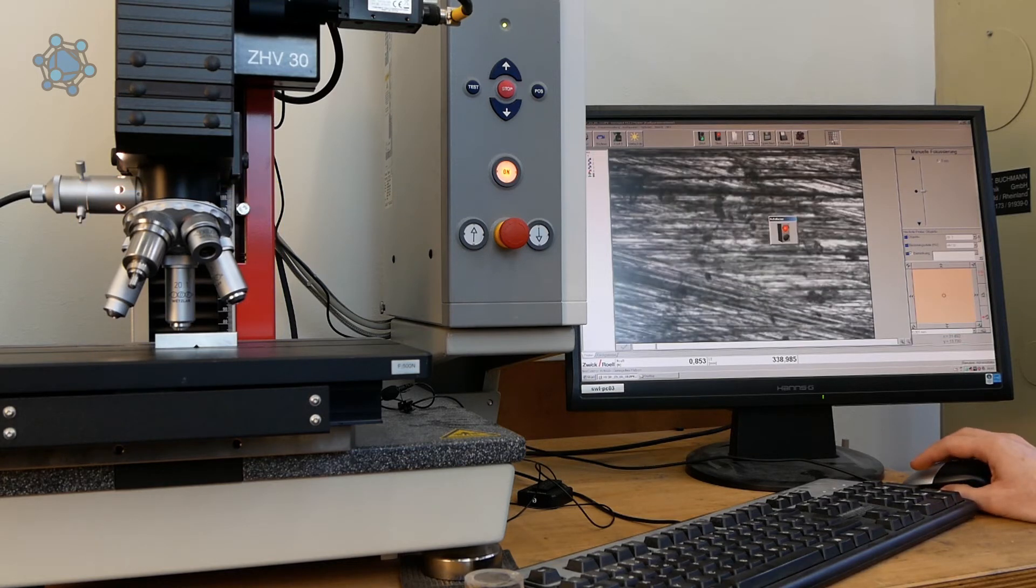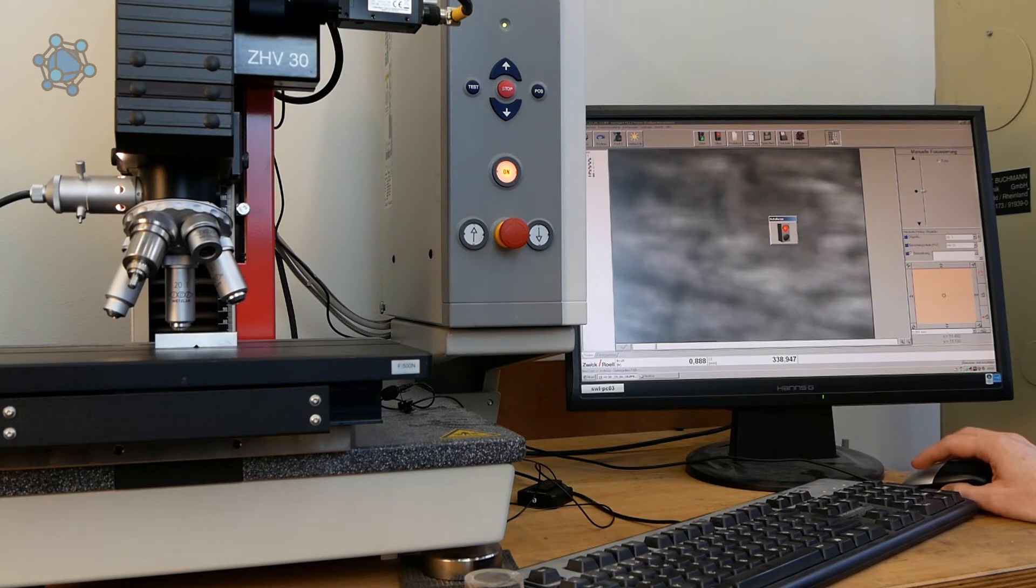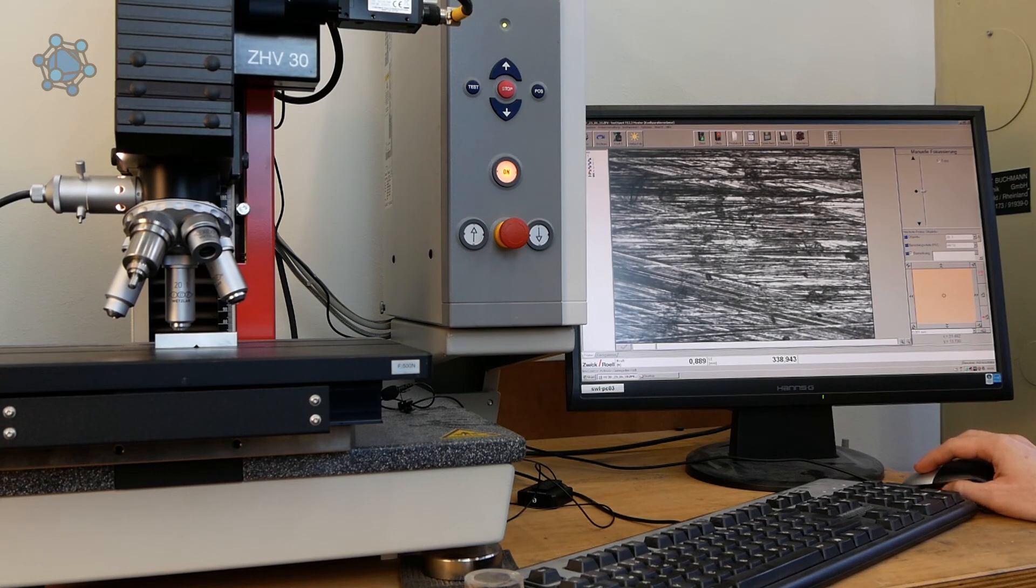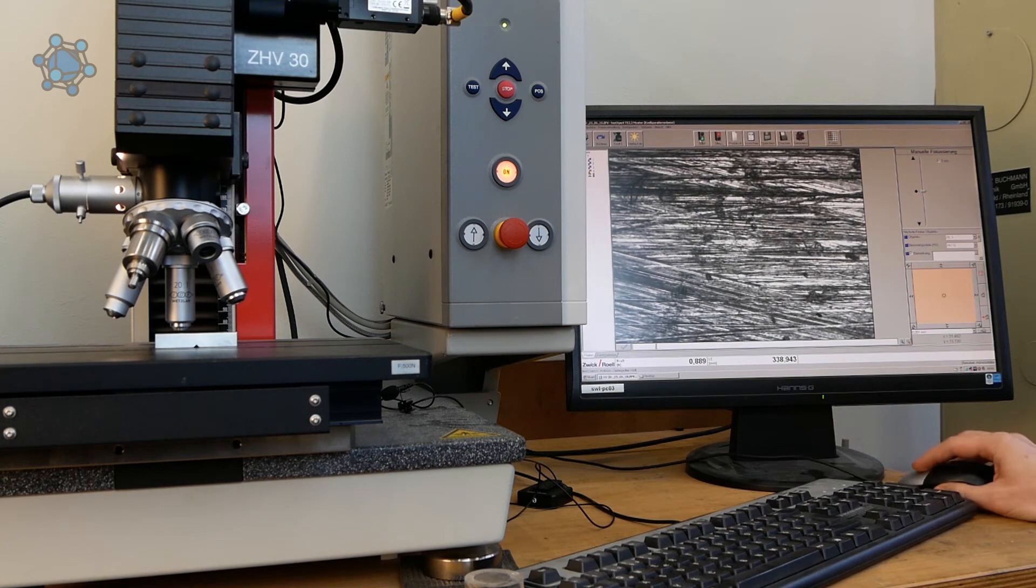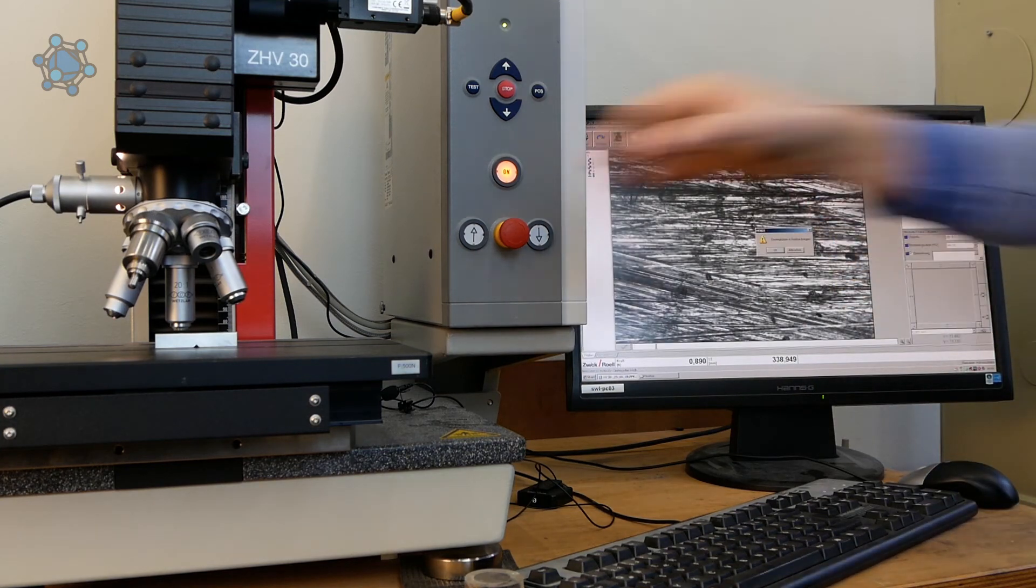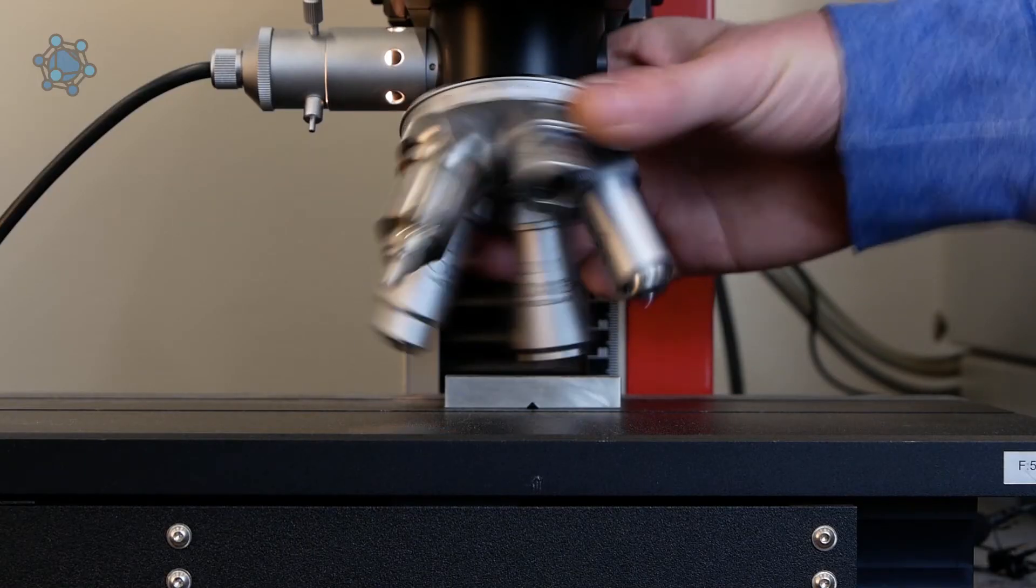Since this is not the case, the position is adjusted electrically until the camera image is suitably sharp. The absolute camera focus is set electronically.